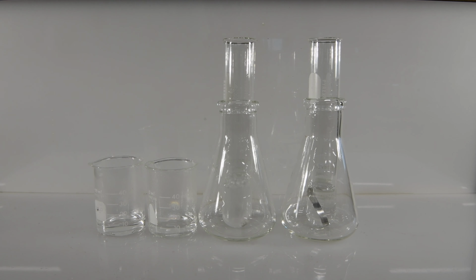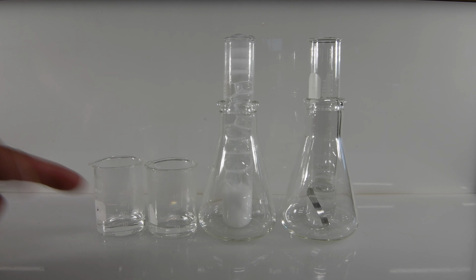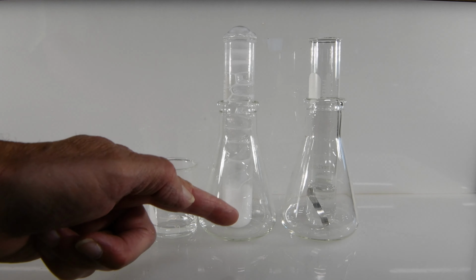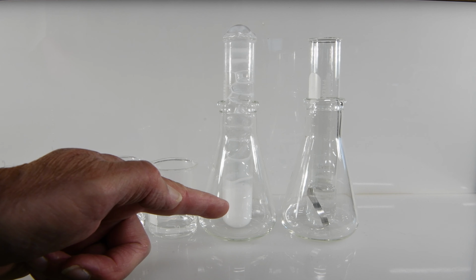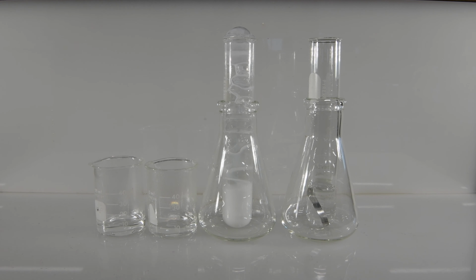It's pretty obvious in this case that the calcium is very reactive in water, but the magnesium is basically doing nothing. So based on these results, we can conclude that calcium is definitely more reactive than magnesium. In the hydrochloric acid, both of them appeared to be equally reactive because hydrochloric acid is a very powerful substance, but in water, the calcium clearly reacted quite vigorously, while the magnesium is not reacting at all.